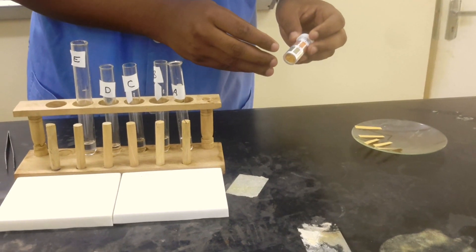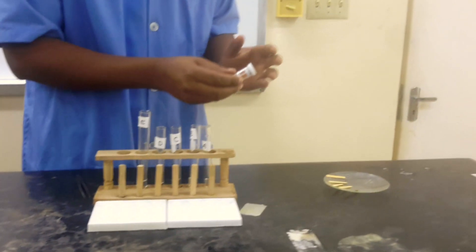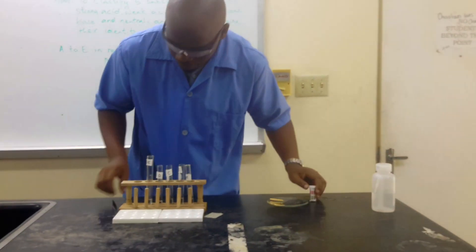After that, we're going to use our knowledge of strong acids and strong bases to figure out which solution is which. So let's start with the first one.